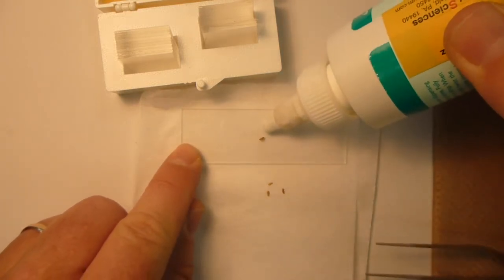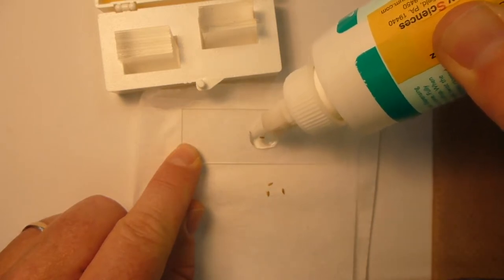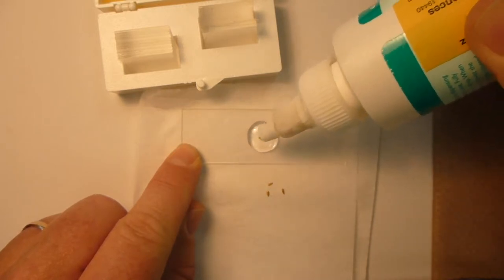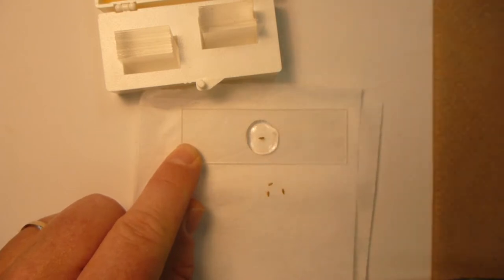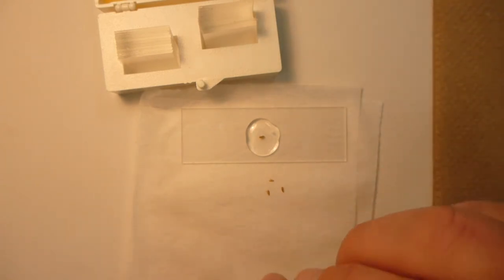I'm going to simply ring that specimen with a good-sized droplet of preservative. Make sure I close the lid on the preservative immediately. The exposure to air will cause the stuff to gum up over time.